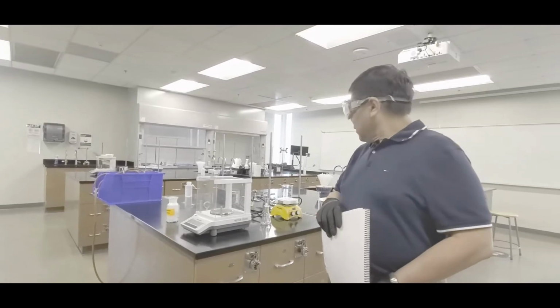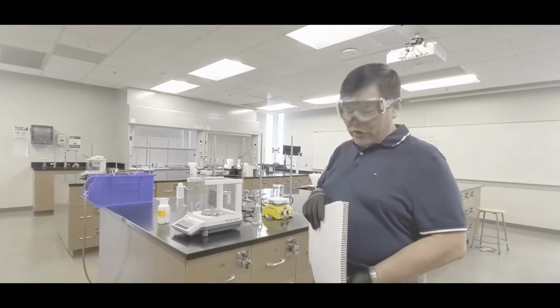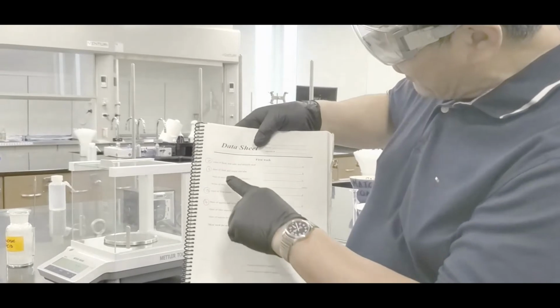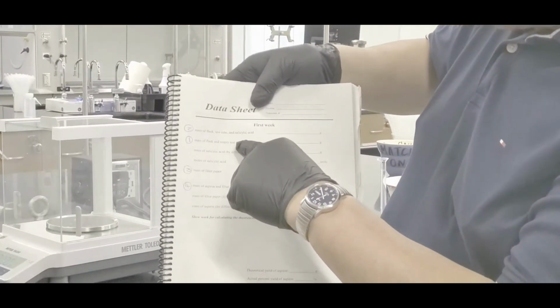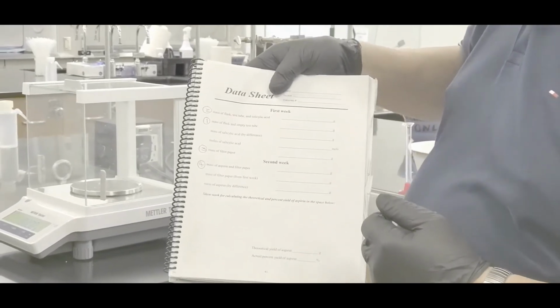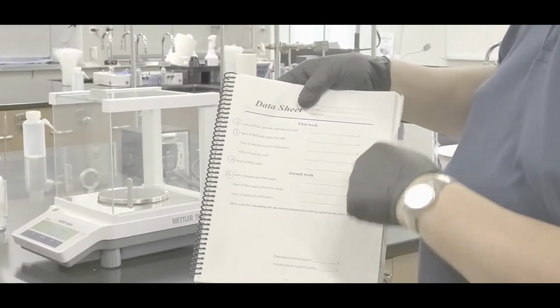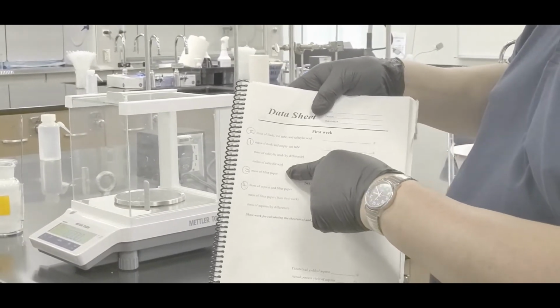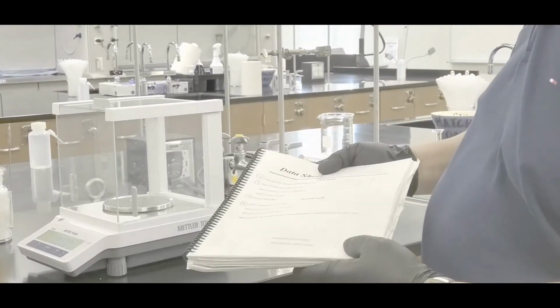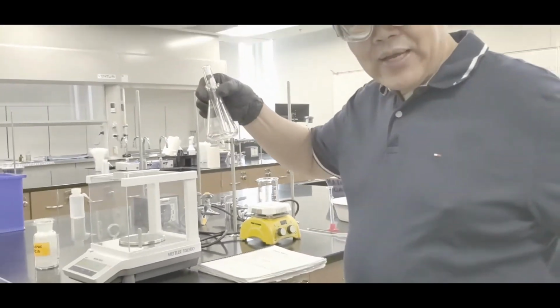All right, class. Now, we just put the water into the ice. The next thing is we need to get the appropriate amount of material. So if you look on page 41 of your lab manual, the procedure is such that you have to get the mass of the flask and the empty test tube. Afterward, you weigh the amount of salicylic acid, park it into the test tube and weigh that, and of course while you're doing it, you might as well also get a filter paper and weigh that, yeah? So I'm going to gather the stuff. I'm going to get the flask weighed first, okay? So, there we go. Got the flask with the test tube.